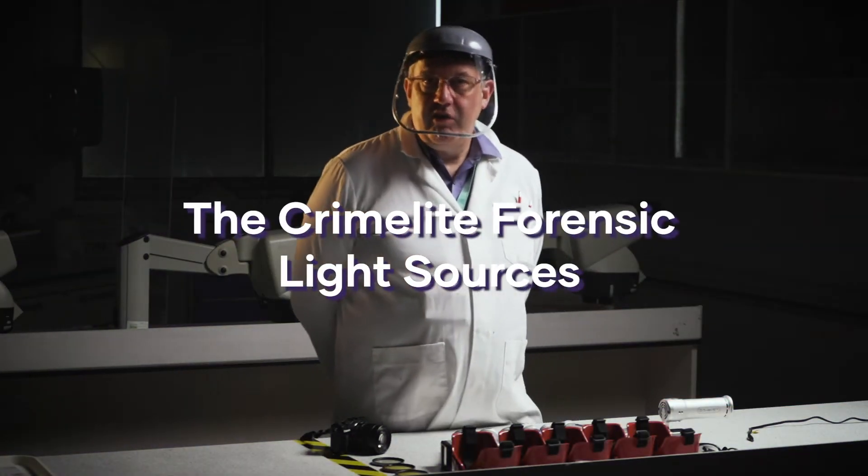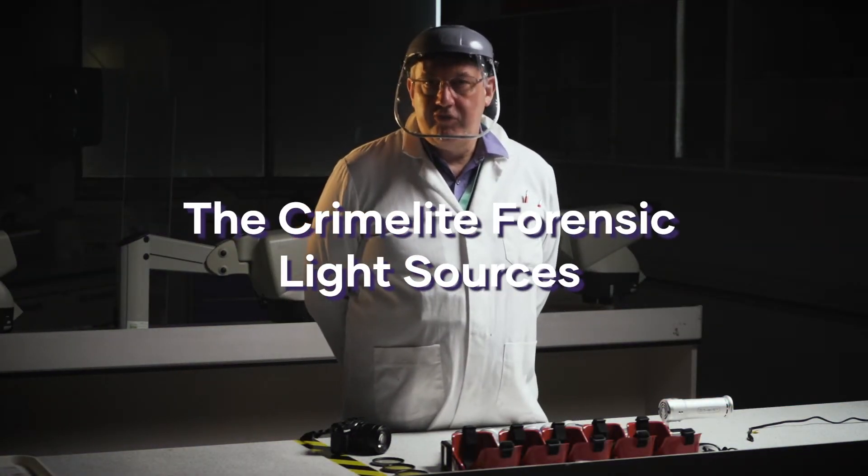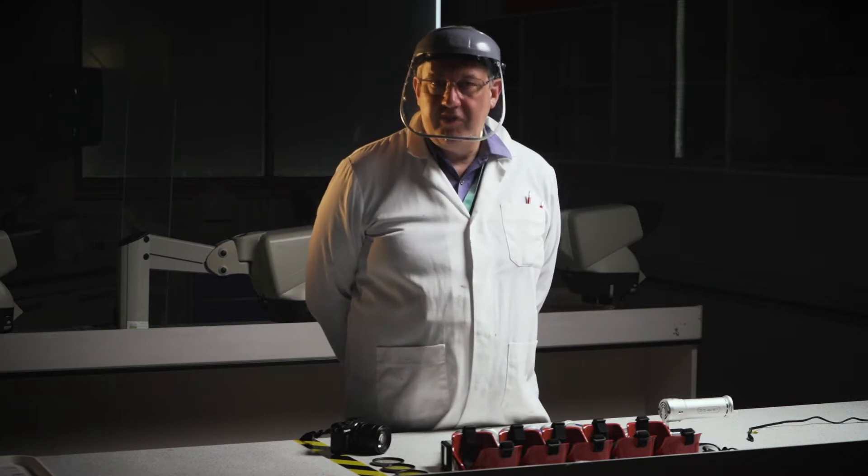Today I want to demonstrate the series of Foster and Freeman forensic light sources that we have here at London South Bank University.